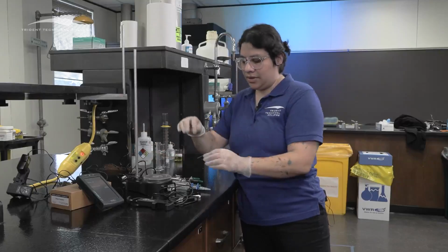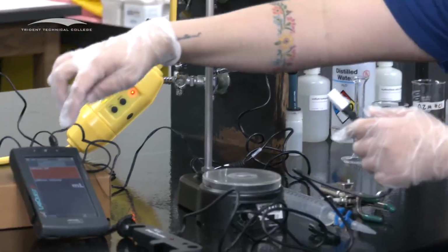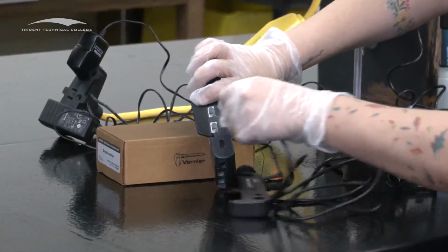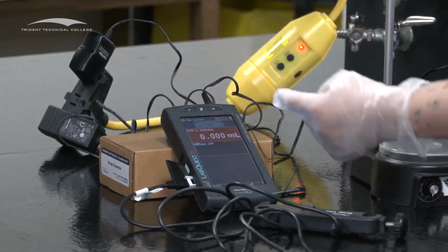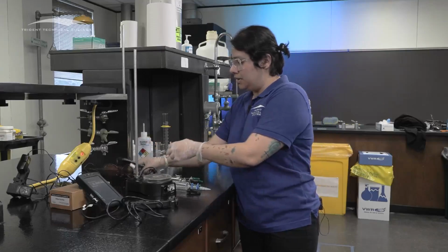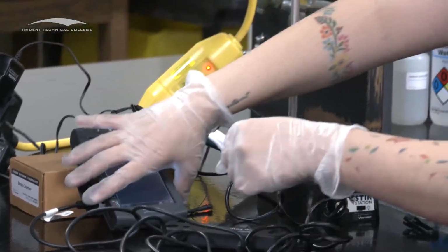The first thing before you set up is to plug it in. This one is very different from what you're used to. There is a plug at the top of this, and then you open it, and it goes in there. It doesn't go on the regular ones. And then you should see volume should say 0.00. The pH probe goes in the regular ones, and this is going to be a lot of cables.